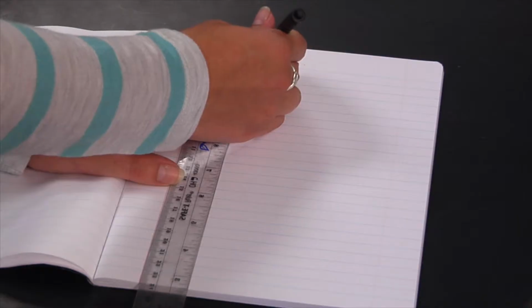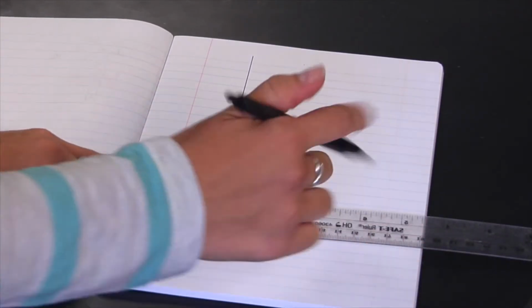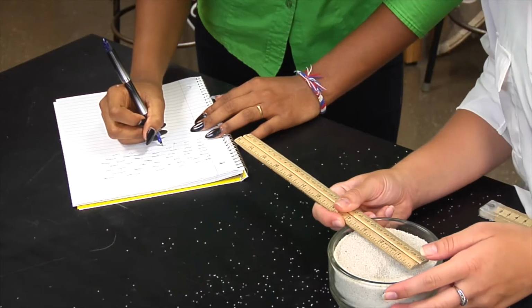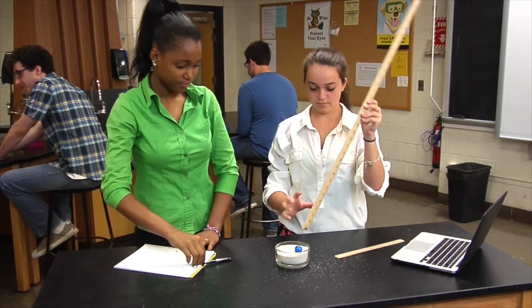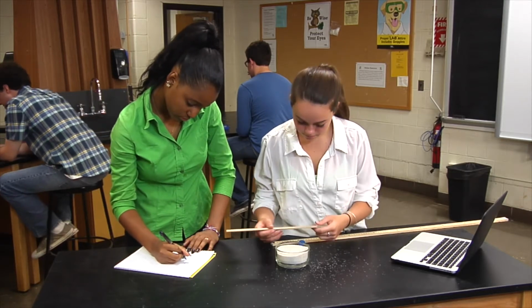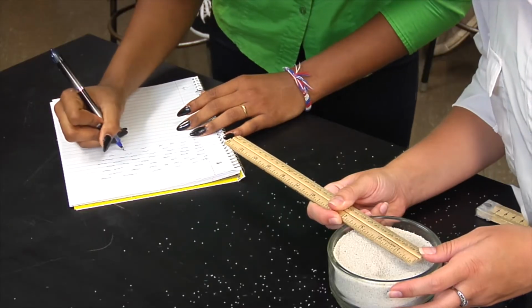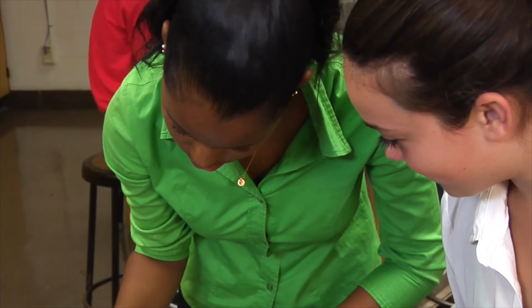When recording any type of observation, it is important to use a dedicated lab notebook so that all of your information remains in the same place. It is also important to write only in pen so that data cannot be erased, only crossed out. Observations should be recorded while the experiment is being conducted, not after the experiment is completed. This will ensure that the information written down is current and as accurate as possible. There should be enough information written down so that another person, unfamiliar with the experiment, could easily replicate the experiment from your notes and observations.